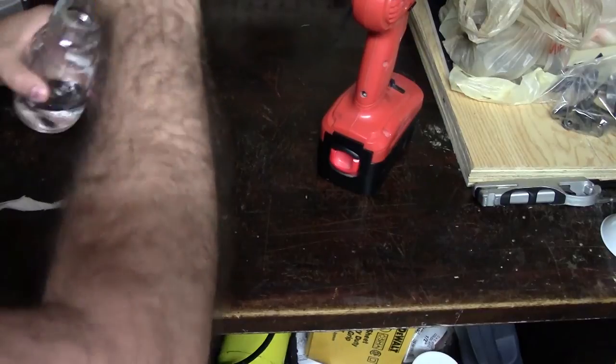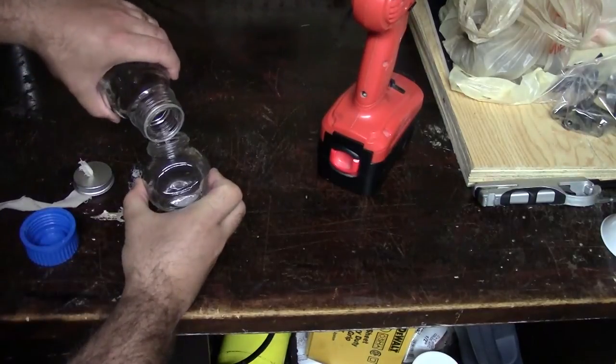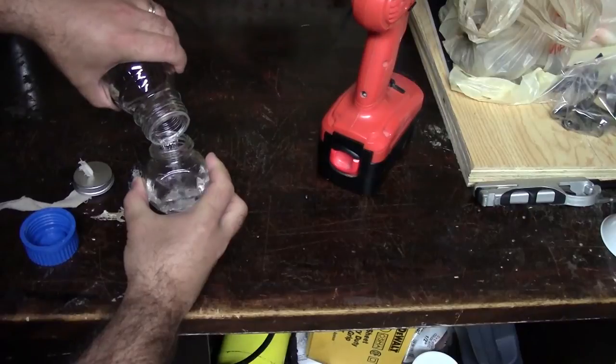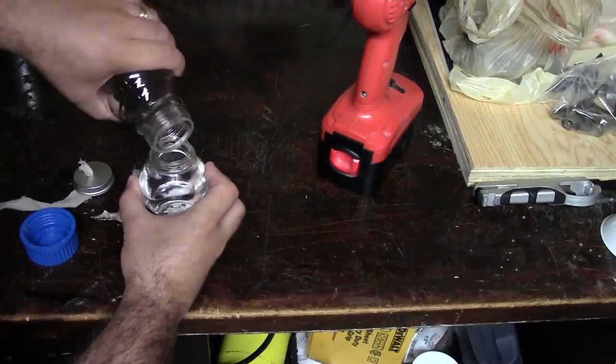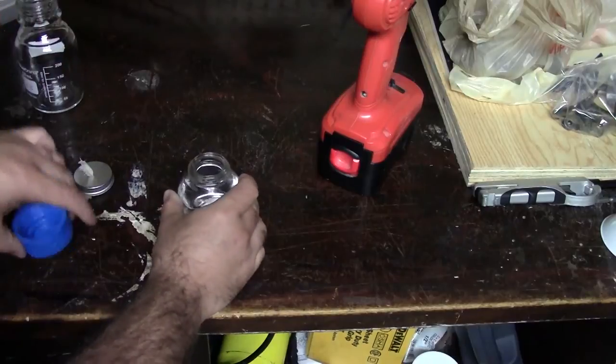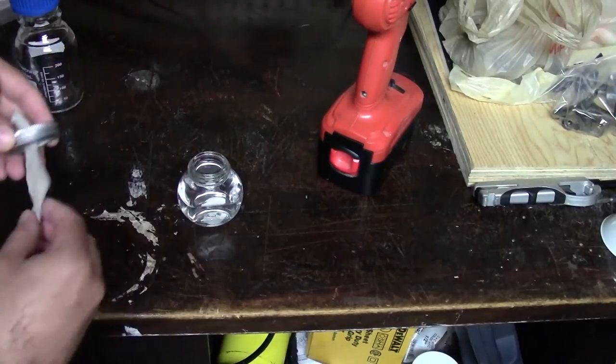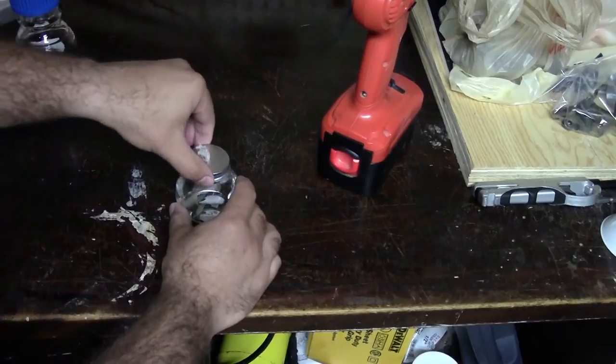Now we want to fill our jar with our fuel. You want the container as full as it'll go, although if you have enough to completely fill the jar, you'll want to make sure there is a small air space at the top.